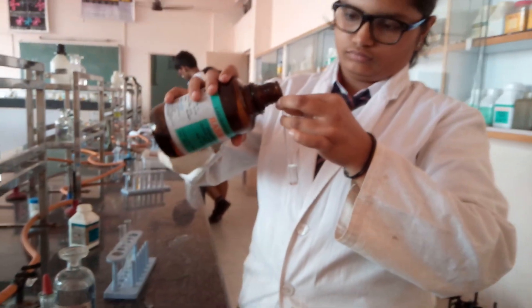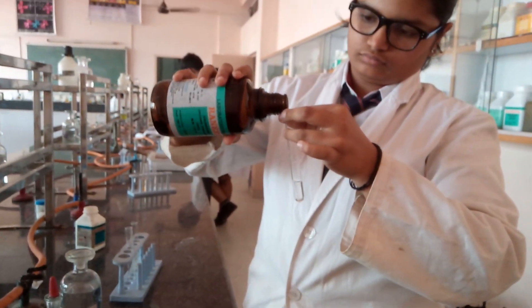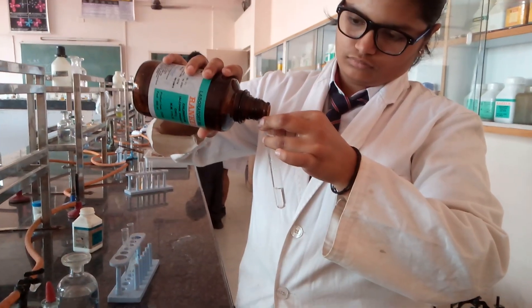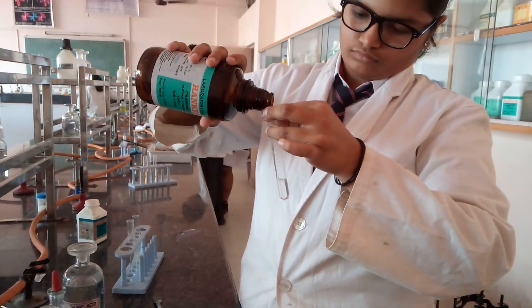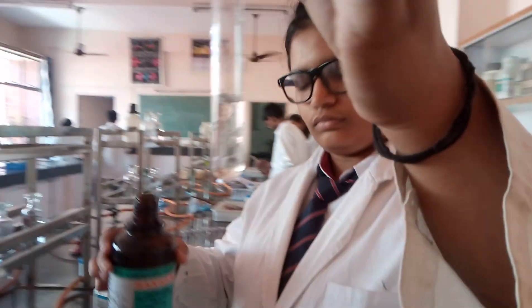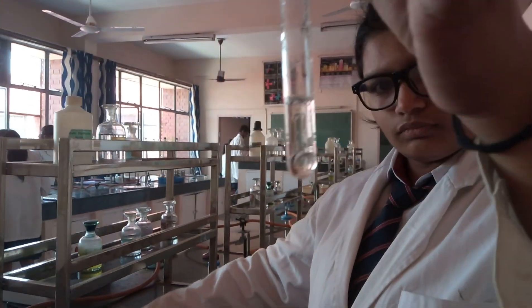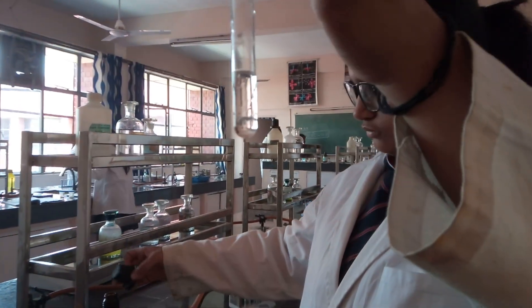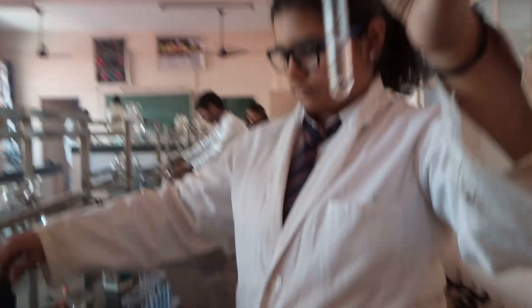The organic layer is an organic solvent — we are using chloroform. You can also use carbon tetrachloride or CS₂. Chloroform, being heavier and denser than water, takes up the lower layer. You can see there are two layers in the solution, showing the water layer and the organic layer, which is the heavier lower layer.